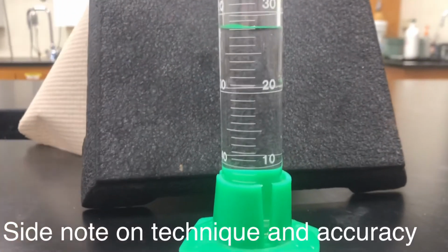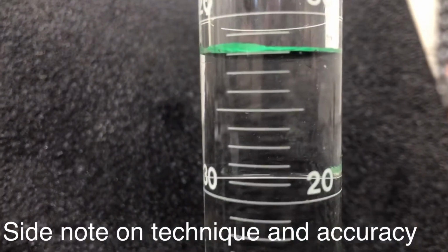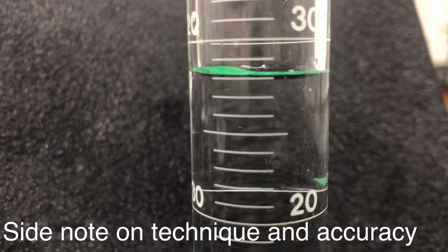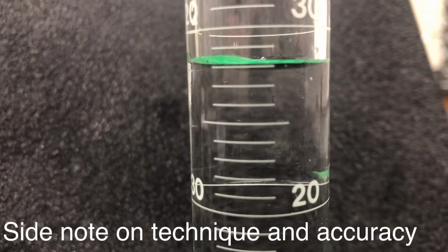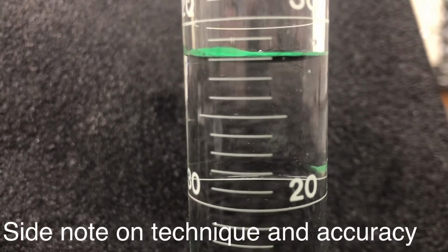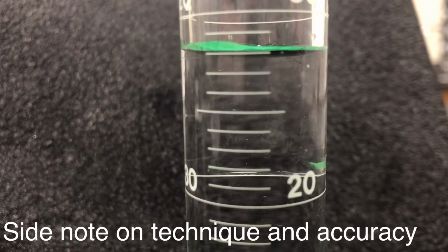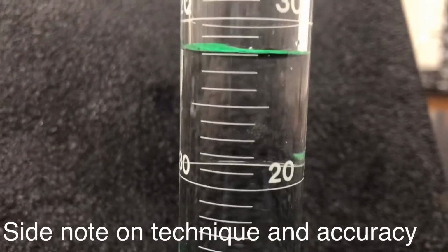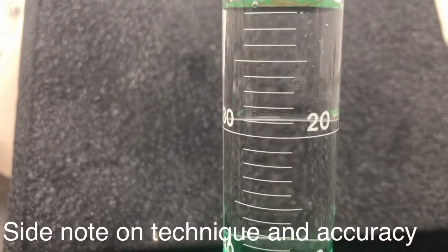Accuracy. What would happen if we said that we were only going to use one penny? So if we had a starting volume of this. Now remember, if I'm looking at this, it is above 27 milliliters but less than 28. So I'm going out to 27 point something. So this is give or take 0.1 milliliters, correct? So if I only put in 1 penny, how much did that go up?